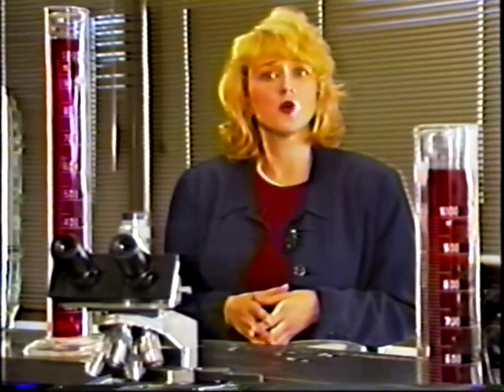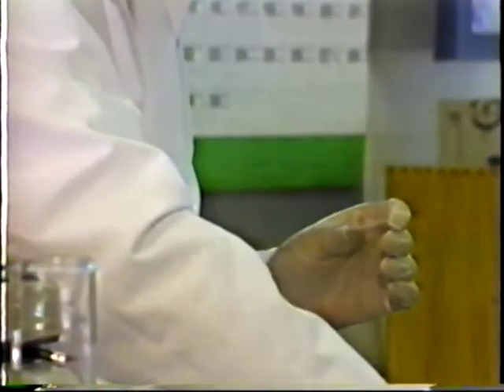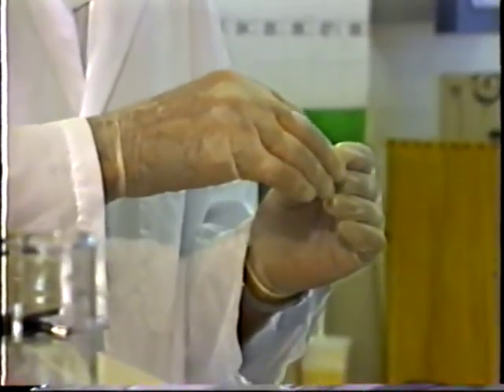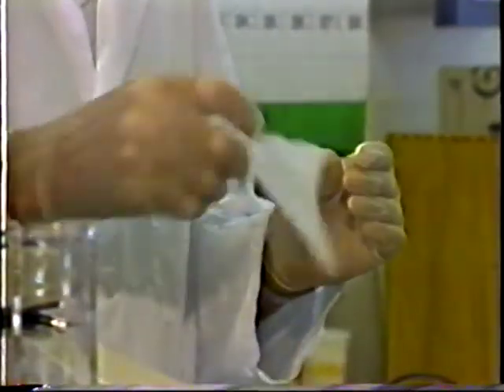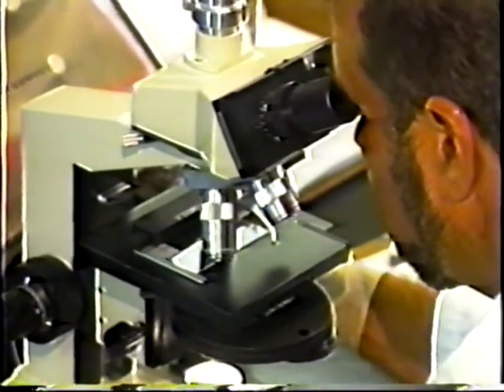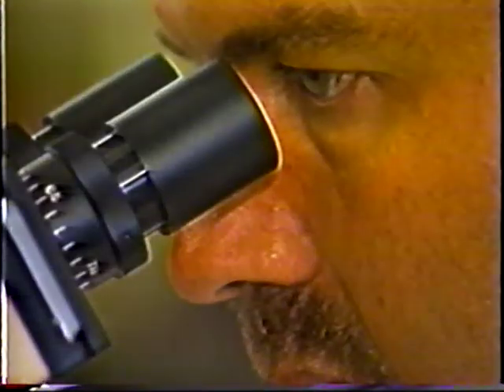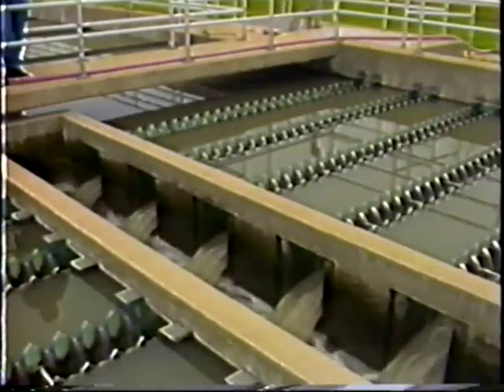Filament identification requires observation of a mixed liquor suspended solids, or foam sample, using a phase contrast microscope capable of magnification to 1,000 power. This involves using an oil immersion lens. An ordinary light microscope cannot be used for filament identification. One drop of the mixed liquor suspended solids, or foam, is placed on a microscope slide, covered with a No. 1 cover glass, and gently blotted with tissue to remove excess water. This is then observed at several magnifications to determine the characteristics of the filament present. Also, the Gram and Neisser stains are used to further characterize the filaments.